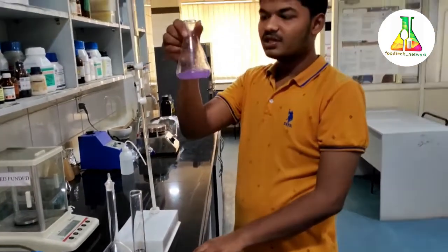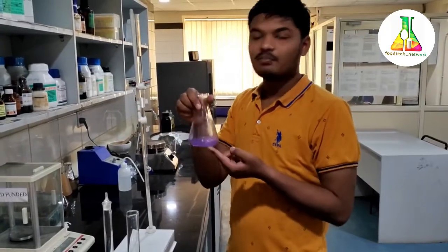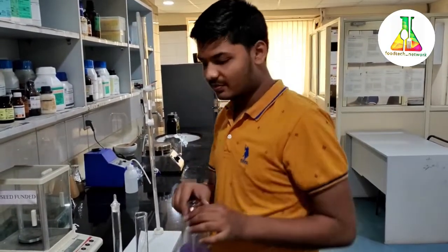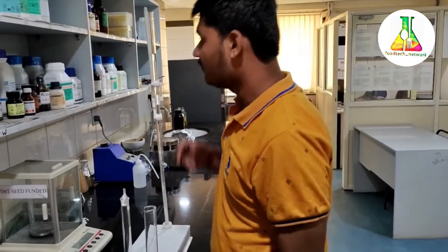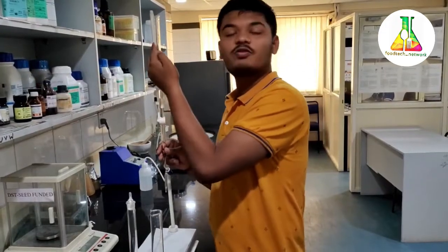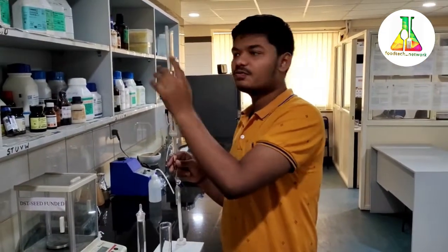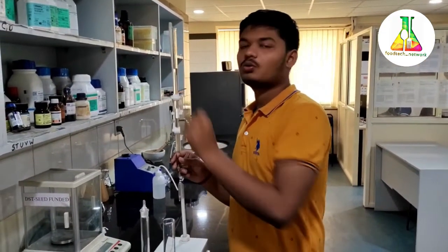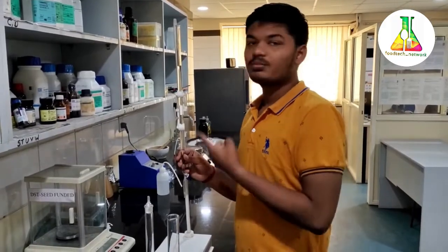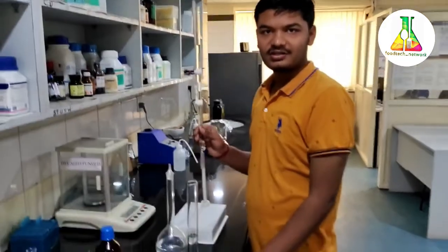A pale pinkish to violet color has been obtained, and this is the end point of our experiment. We will now calculate the reading. It is around 1.8 ml of 0.1 normal sodium hydroxide solution, and from this volume the free fatty acid content can be calculated.